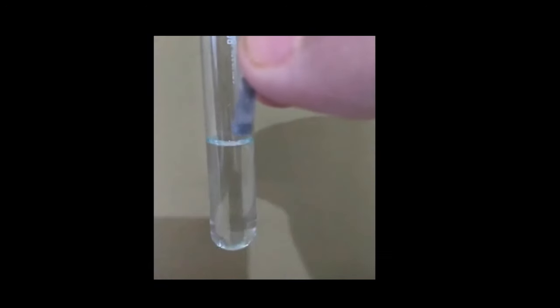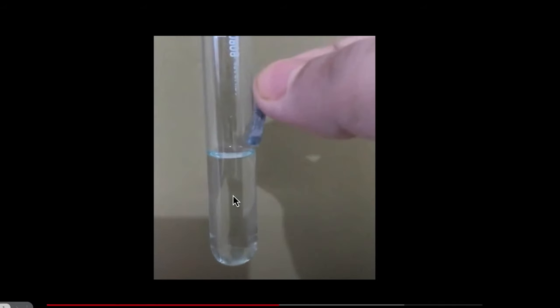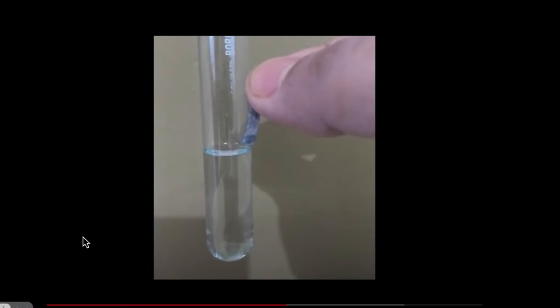Okay, now let's do another experiment. This time, we are going to add magnesium to the same dilute hydrochloric acid. And let's see what's going to happen.